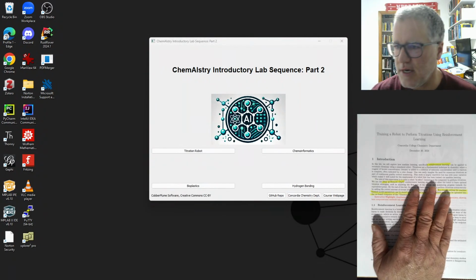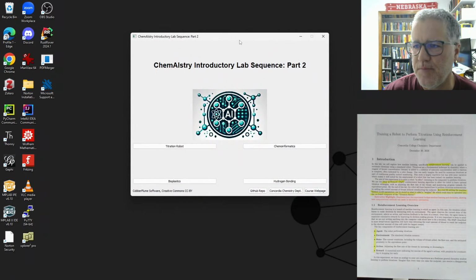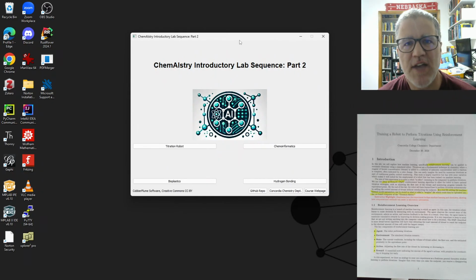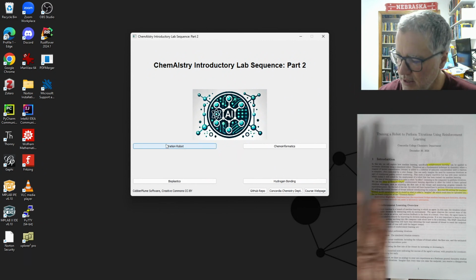Okay, so here's our setup. Hopefully you've got this up on your computer. If you haven't, go back to the first lab in this playlist, or not even lab, but just the introductory video in this playlist to see how to get that all set up on your machine. So we'll be doing the titrating robot here.